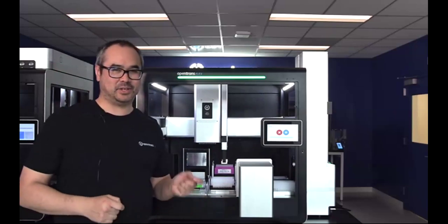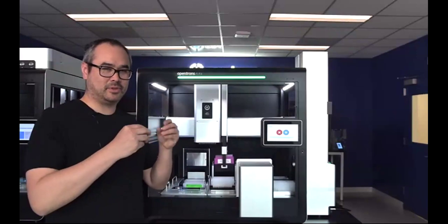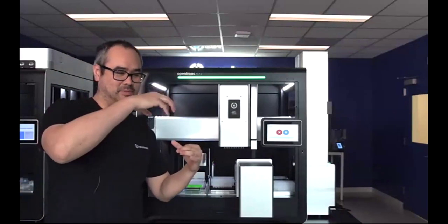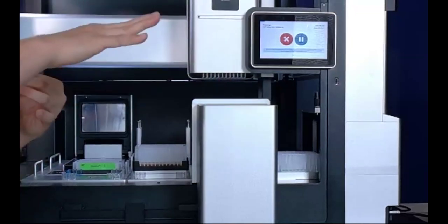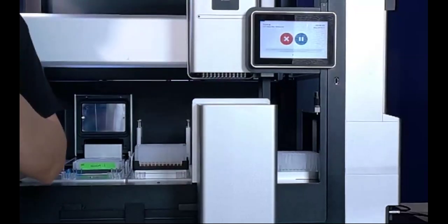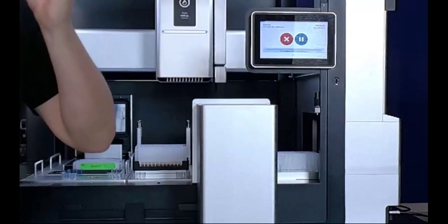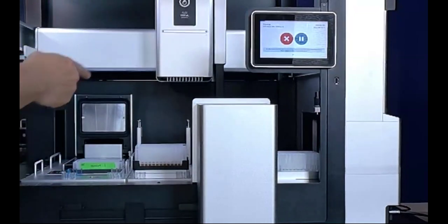And that has its own challenges. The reagents now are, instead of a single column, distributed into a single plate so that the whole 96 channel can pick up the entire reagent amount and distribute it to the plate. To do that, we need a lot more deck space because all reagents can't be combined onto a single plate. They have to be plated out individually, and that takes up a lot more of the deck real estate.